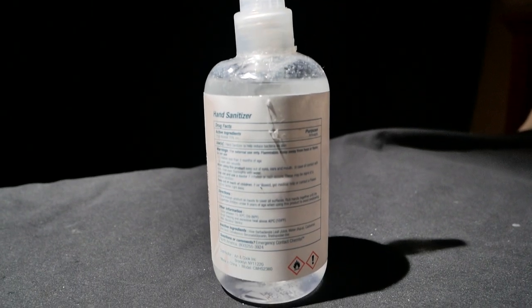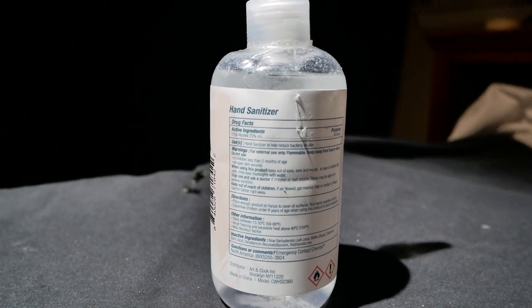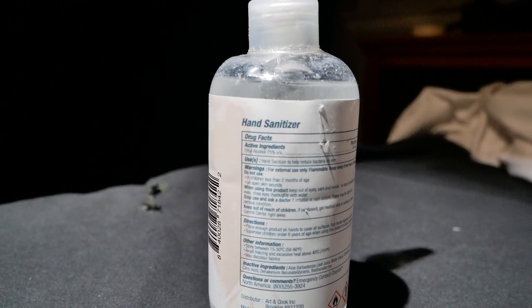I recently found this hand sanitizer bottle and this stuff smells like dog piss. I was about to throw it out but I realized this stuff is packed full of alcohol. 75% to be exact.